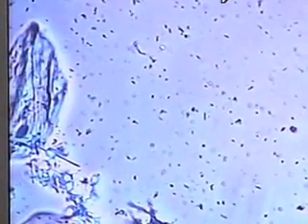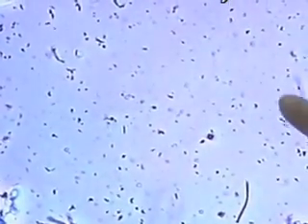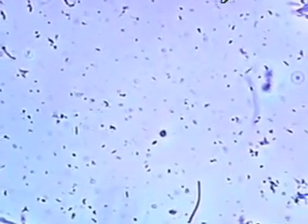We point out that there are different shapes of bacteria: some are long and thin, some are round, and some move quite quickly, such as this little fellow.